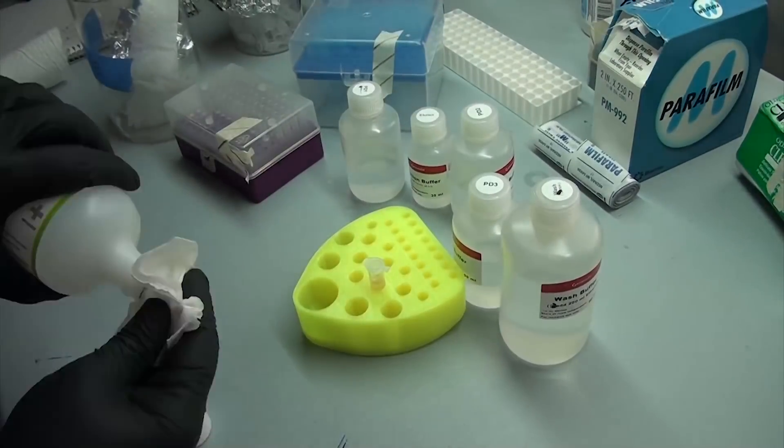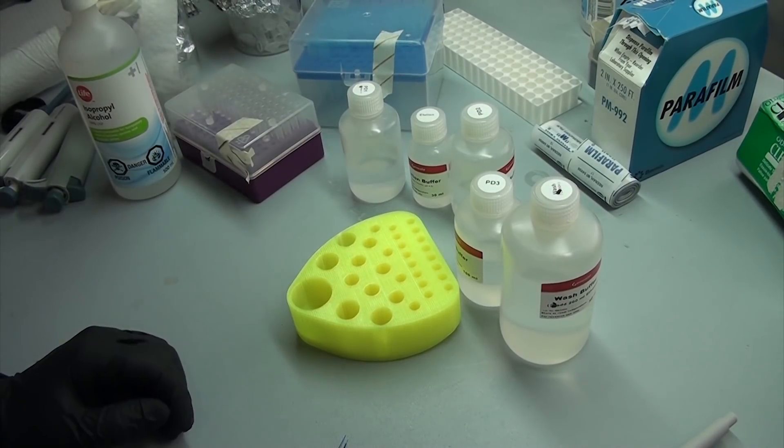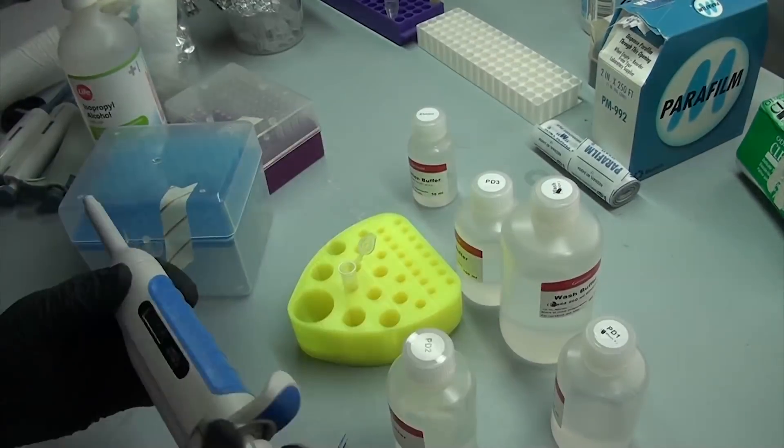But other than that, those are all the basics of DNA extraction using columns. Depending on the style and exact kit, the amount of time it takes can vary, but it's never really a difficult process. It mostly involves planning in advance, getting the right tools, and following the recipe.